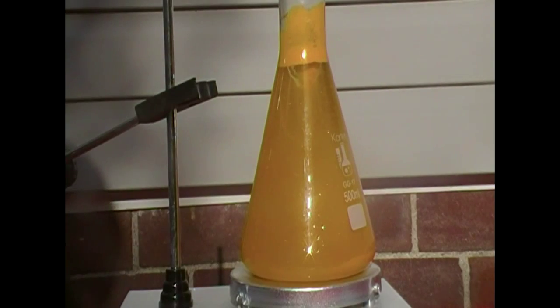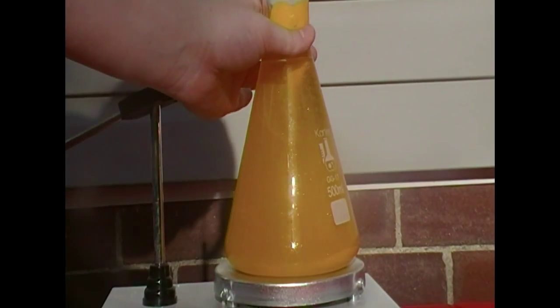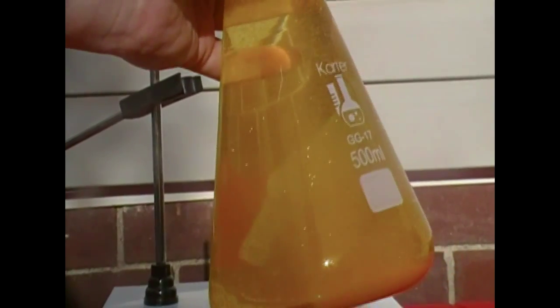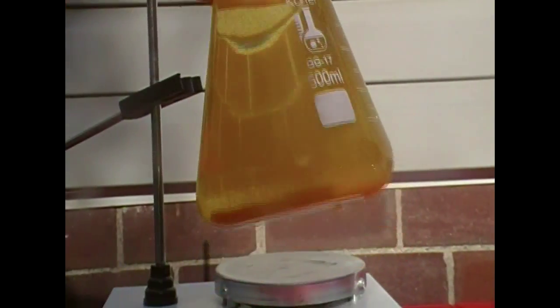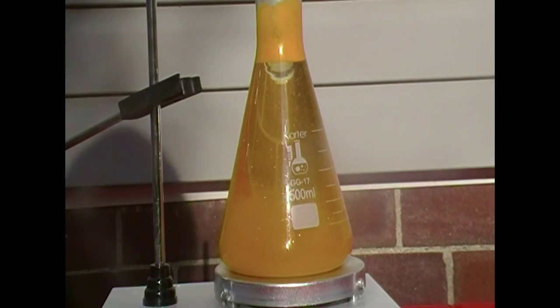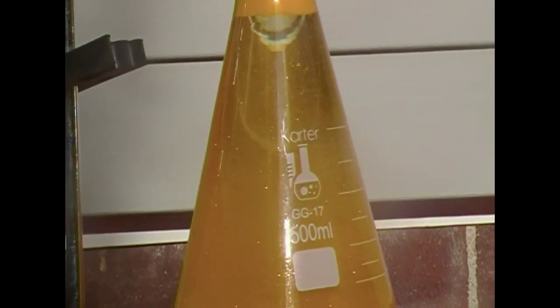So, thanks. Now that we're finally done waiting for all of the lead(II) iodide precipitate to dissolve into solution and then to cool down, we'll be able to see the so-called golden rain. Chemists have called the lead(II) iodide crystals golden rain because of their crystalline appearance and how they reflect the sun's rays once it hits them, and they start to really shimmer a bit. And it honestly does look like golden rain. So that's basically our entire experiment in two parts in one video. I hope you really enjoyed it.